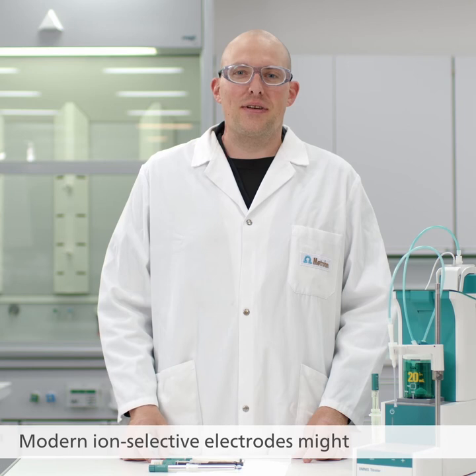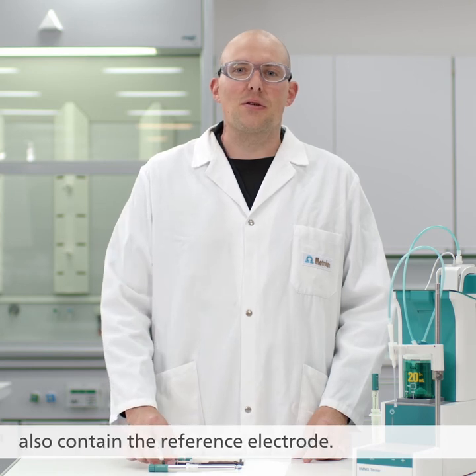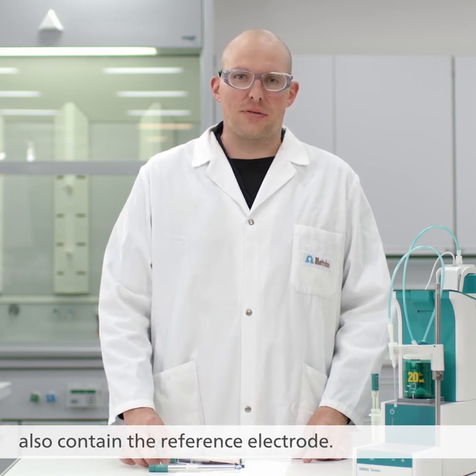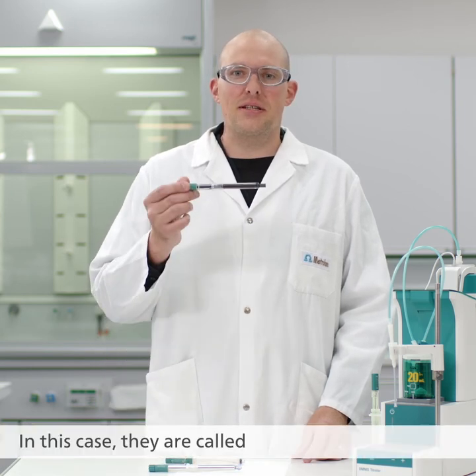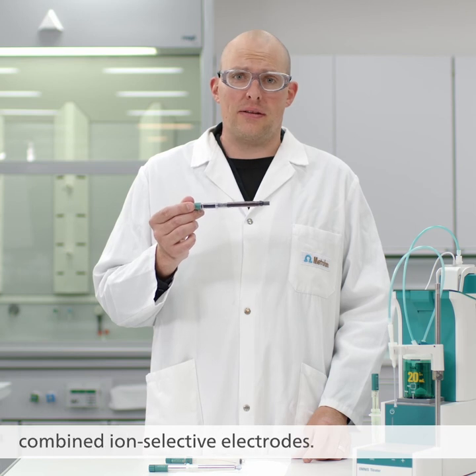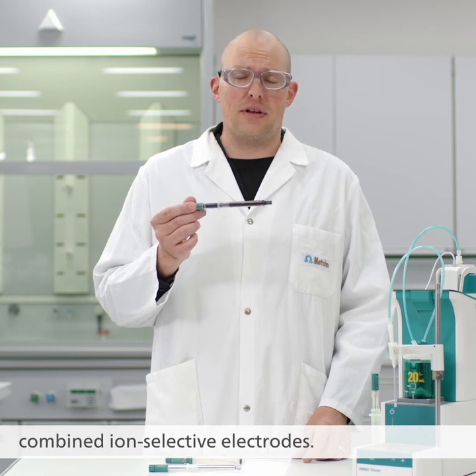Modern ion-selective electrodes might also contain the reference electrode. In this case, they are called combined ion-selective electrodes.